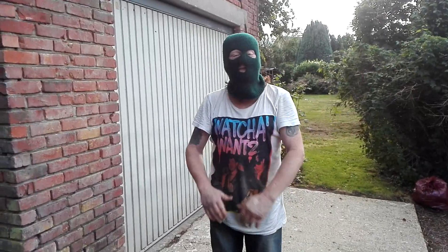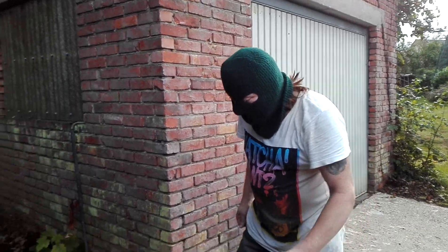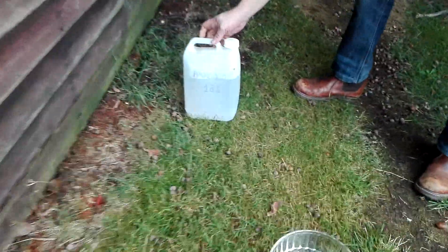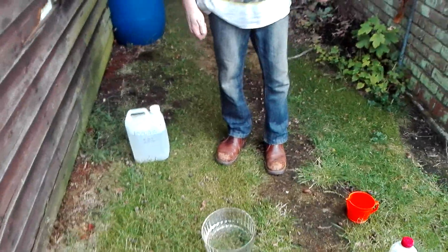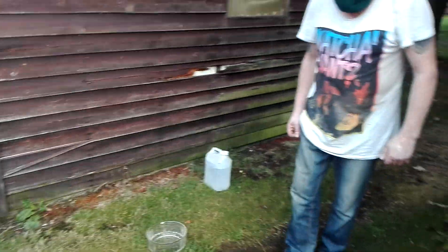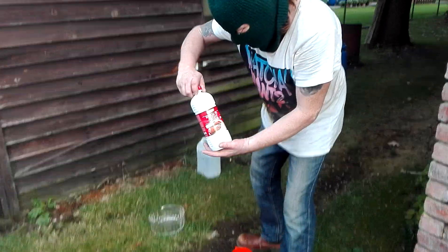Hello people, today we're going to let you see how we make the smoke powder. First of all, we got here half a liter of ammonia, 18%. My cameraman is not feeling too well because he's standing right in the draft of it. Just stand a little to the side. One thing you don't want to do is smell that.